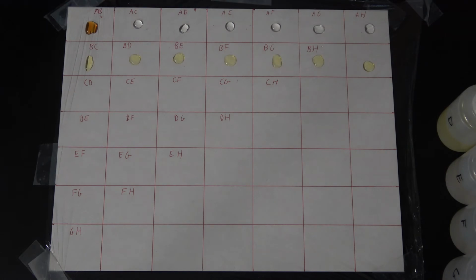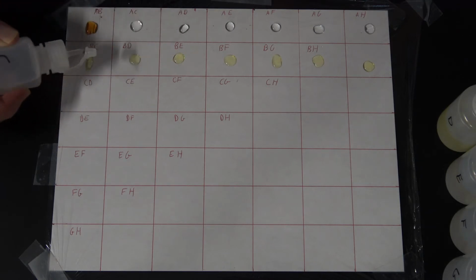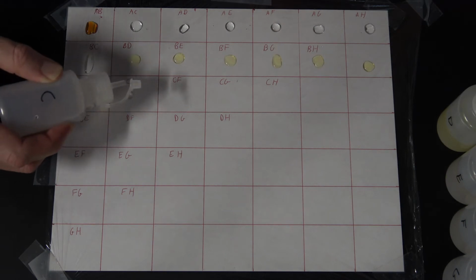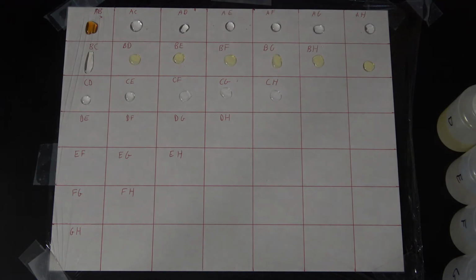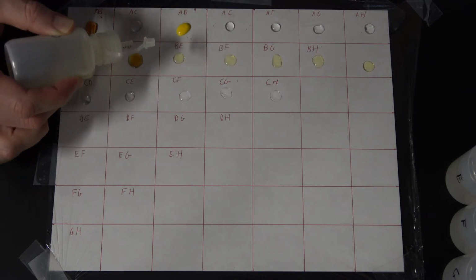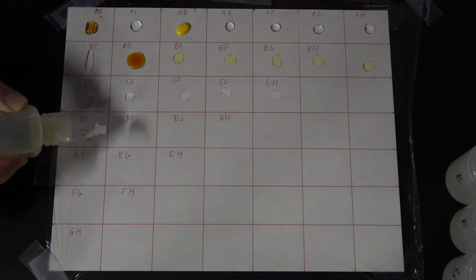All right, C. So we've got AC, BC, good, D, AD, BD, CD, and of course my D's all the way across.